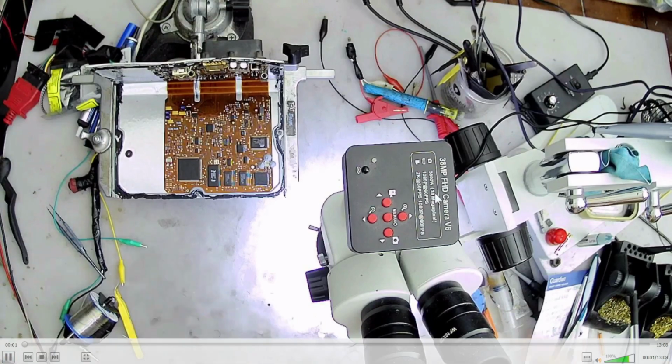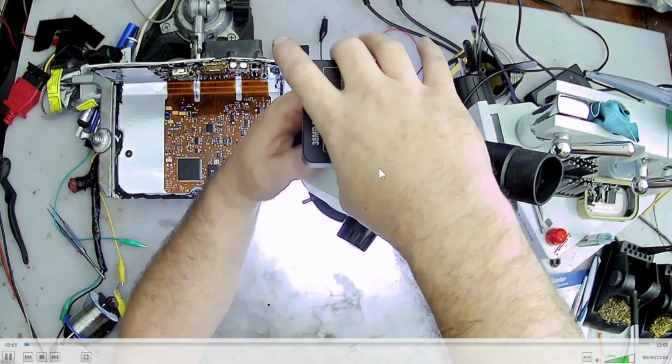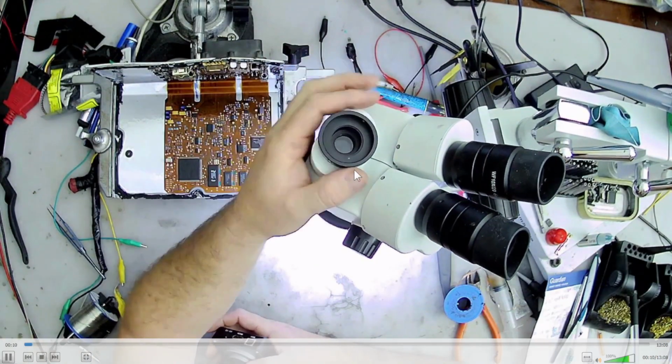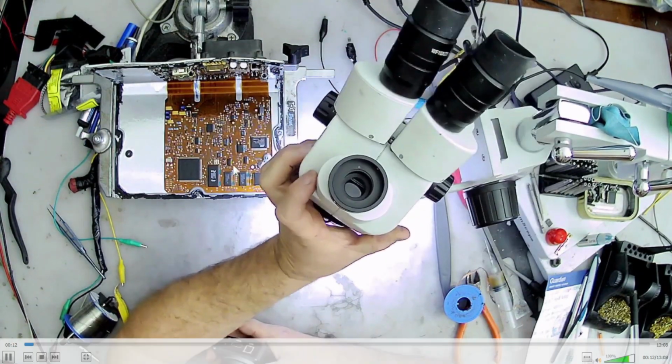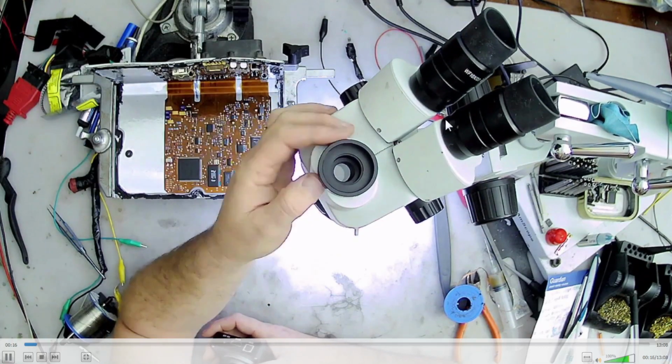But basically my camera port on it was just freely spinning. And it's not just the camera, it's the actual prism and everything. So I would completely lose focus, and I mean it's just almost unusable, because anytime you move the scope, it would just mess up.